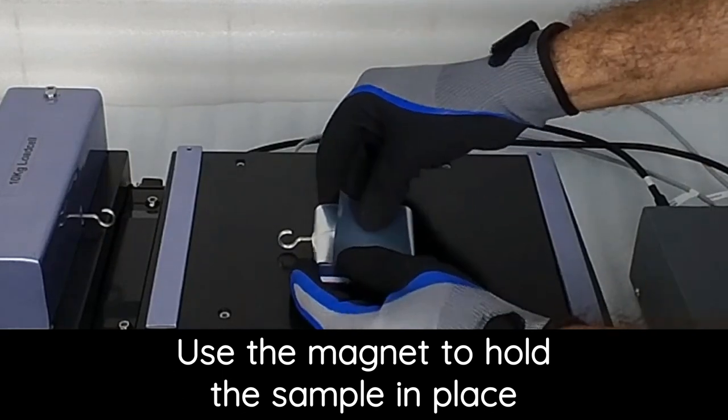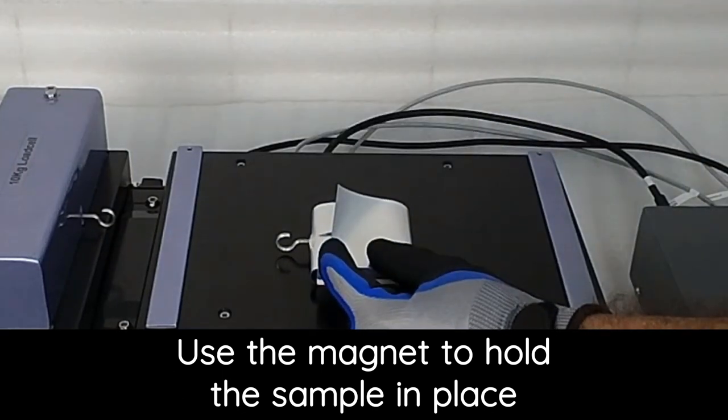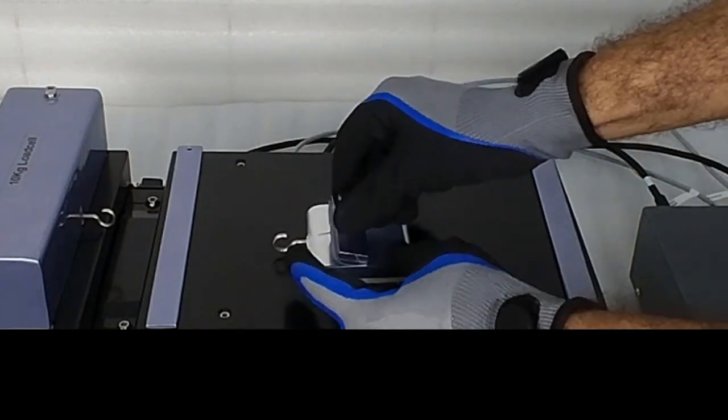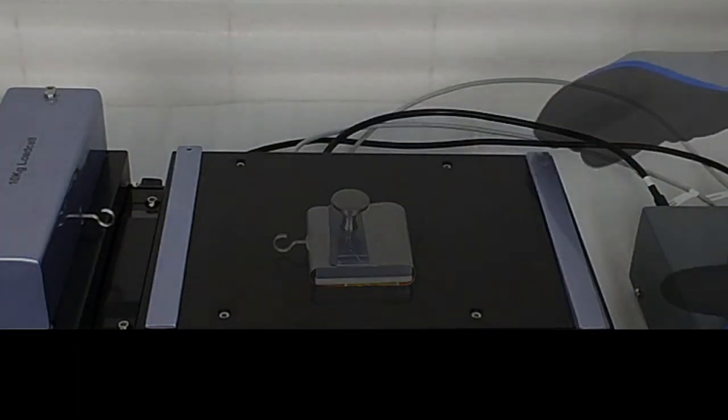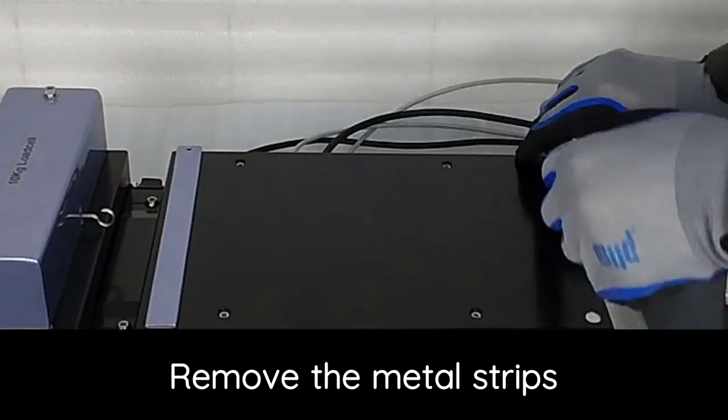Use the magnet to hold the sample in place. Remove the metal strips.